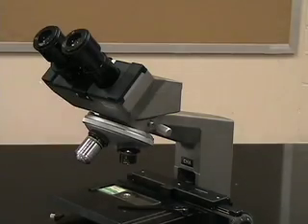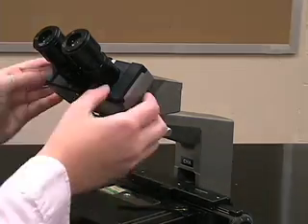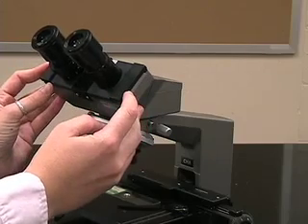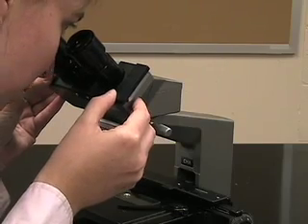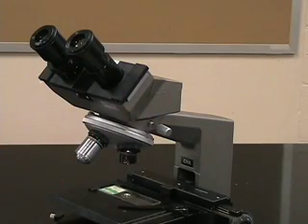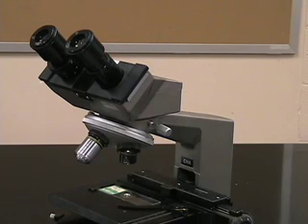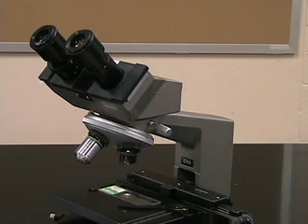Everybody's face and eyes are a little bit different — some people's eyes are close together, others are more spread apart. The microscope accounts for this by allowing you to adjust the interocular distance. To do this, put your face toward the microscope and look with both eyes until you can see straight down through both lenses. Then make note of the number it's set at using the little arrow, so you can record it and adjust easily in the future.